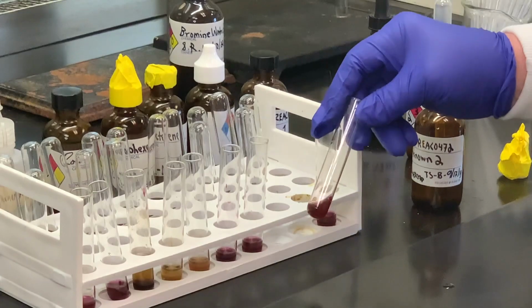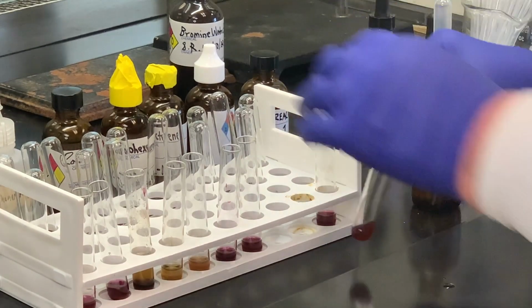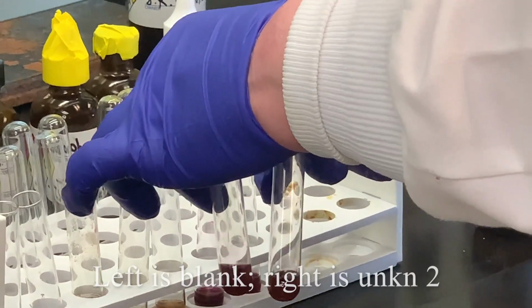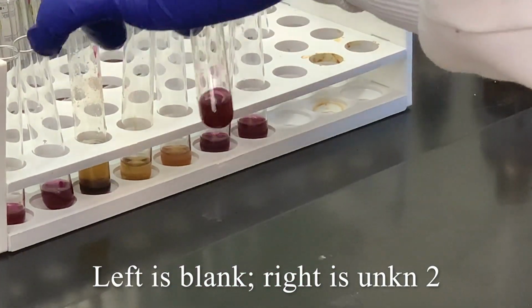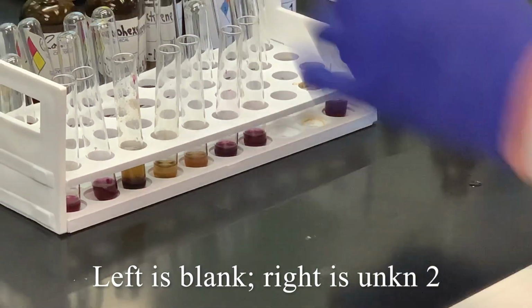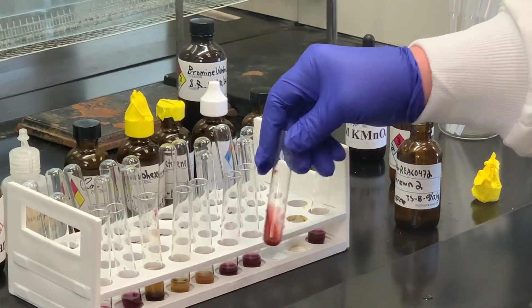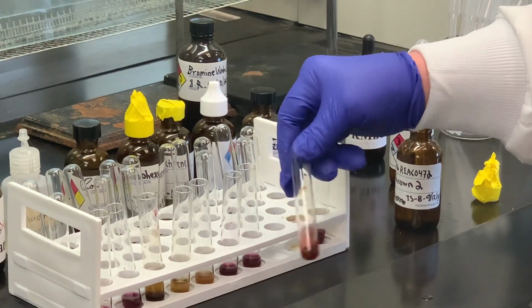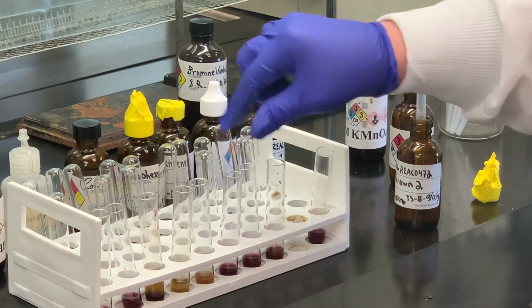You can certainly see that there is a difference in the color there compared to what we started with. This one's getting much lighter in color. That purple color is disappearing. But sometimes it takes a few minutes for these to completely form that brown precipitate. I'm going to come back to this in a second.